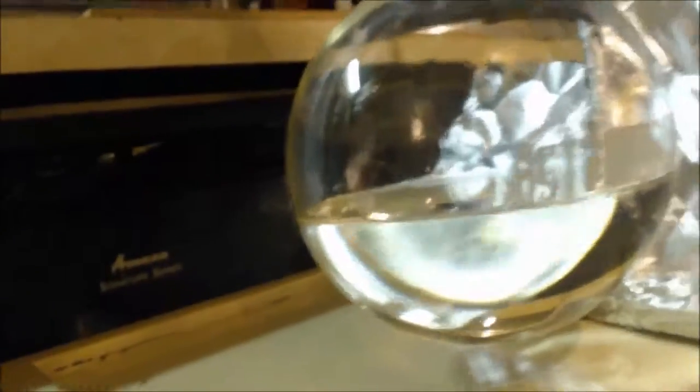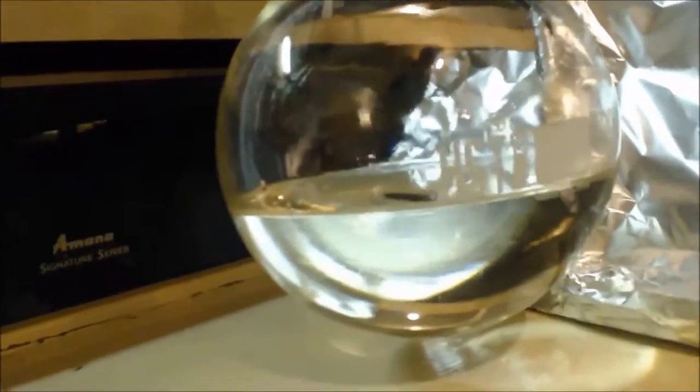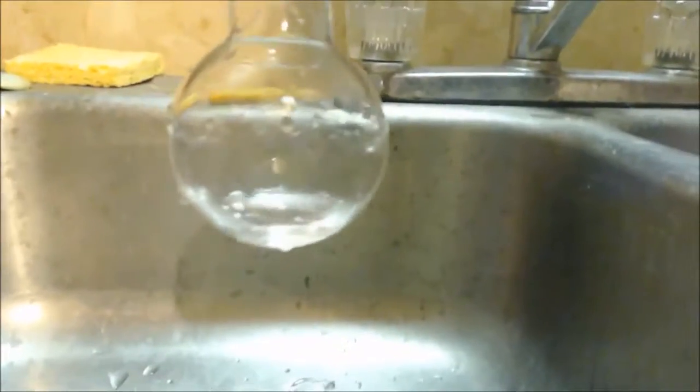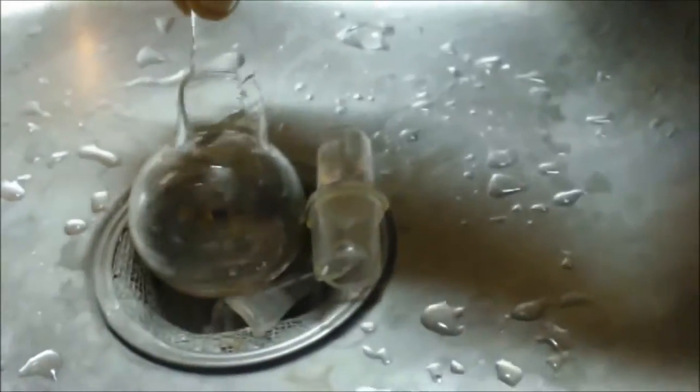Look how clear that is. That is clear. 500 milliliters. I didn't have to distill any of it. I just boiled it. So much static shock around here. I picked this up and I got a static shock. I dropped it. No, it's broke. Anyways, that's how much I got out of there. Some of it might have spilled out of water.